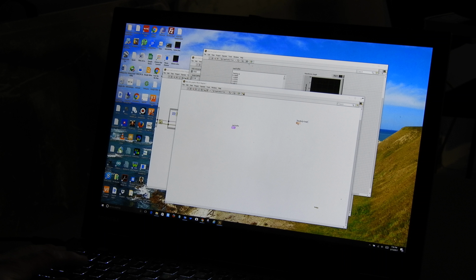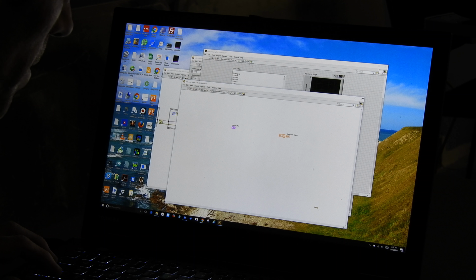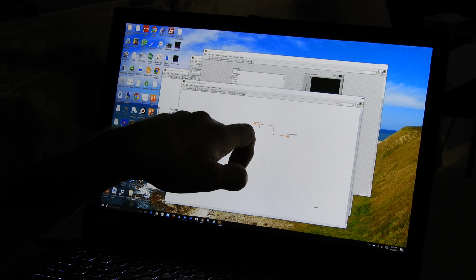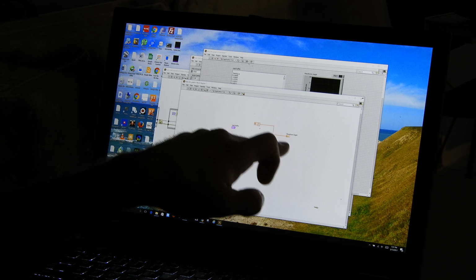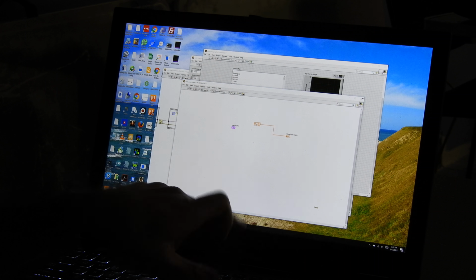and then let's look at what type of data type it wants to be fed by going over here. You can see it is an indicator because you can see that data comes into it. You can tell this is a control, data comes out. But I can tell what type of data needs to come into this indicator by right-clicking on it and saying Create Constant. And it shows me it is looking for a 1D array of floating point values. That's what it wants. If I give this a 1D array of floating point values, it will plot them for me. And I can prove this to you by doing this.